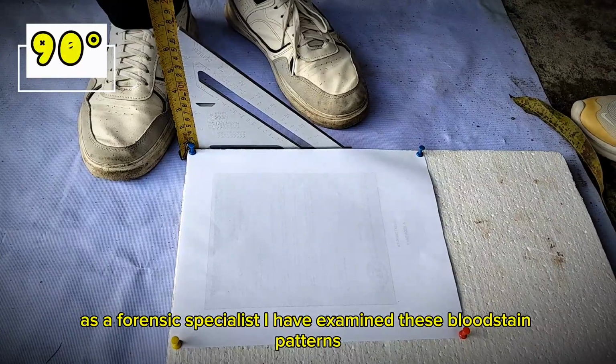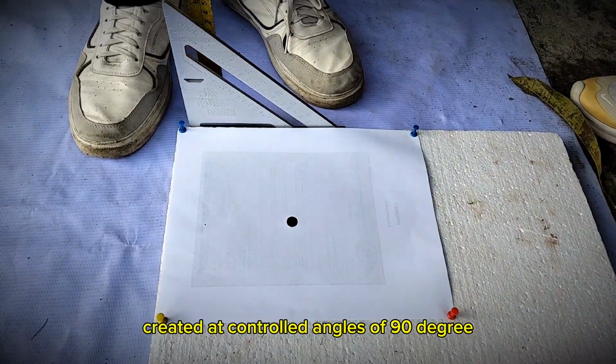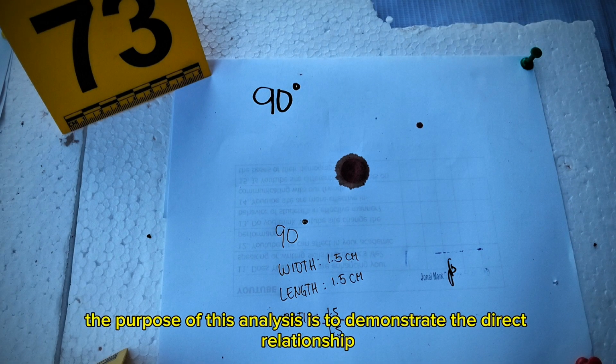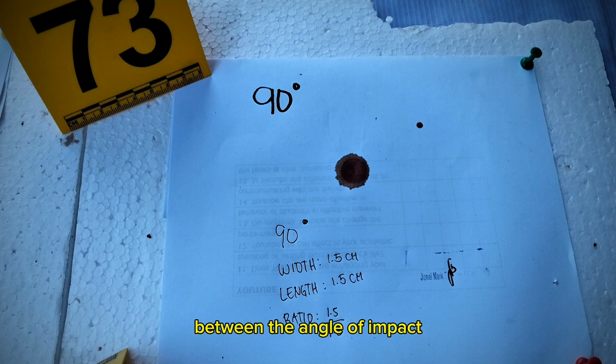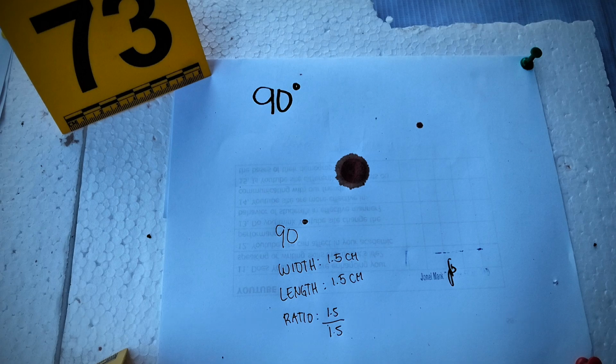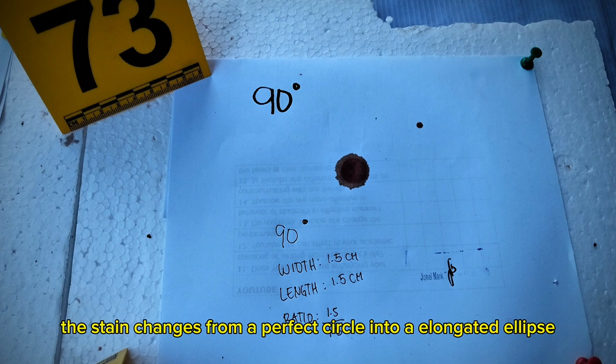As a forensic specialist, I have examined these bloodstain patterns created at controlled angles of 90 degrees, 60 degrees, 45 degrees, and 30 degrees. The purpose of this analysis is to demonstrate the direct relationship between the angle of impact and the resulting shape, dimensions, and appearance of the stain. We use the fundamental principle that as the angle of impact decreases from 90 degrees to 0 degrees, the stain changes from a perfect circle into an elongated ellipse.